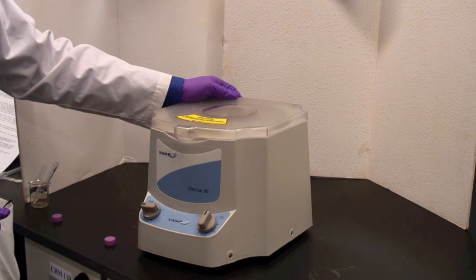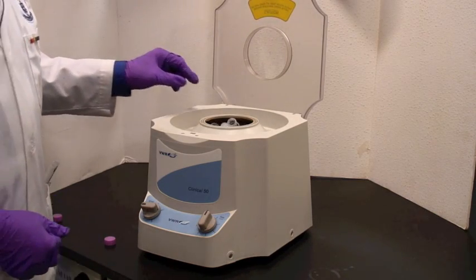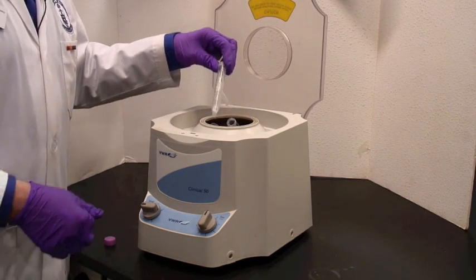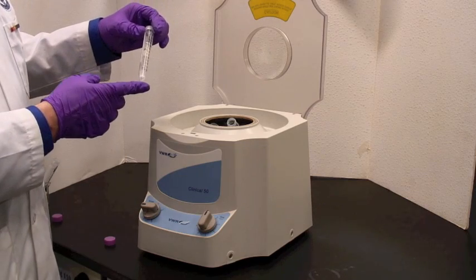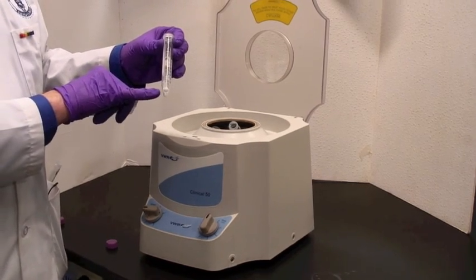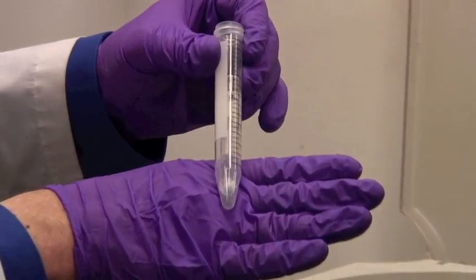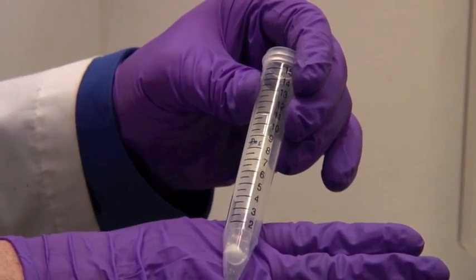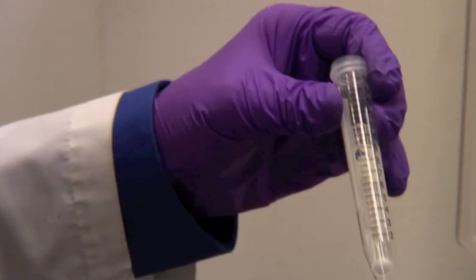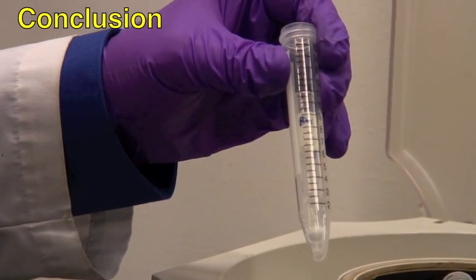This is getting pretty close to slow down and stopped here. Spot number four, this is now my tube. You'll notice at the bottom here that the solid has gone all the way to the bottom of the tube. You can now remove this with your tweezers, and away you go. That's how you should be using a centrifuge.